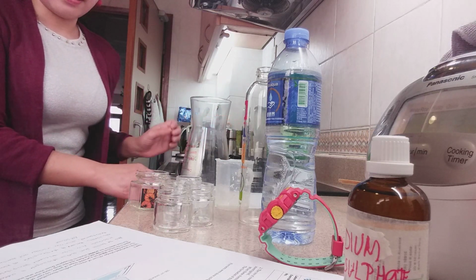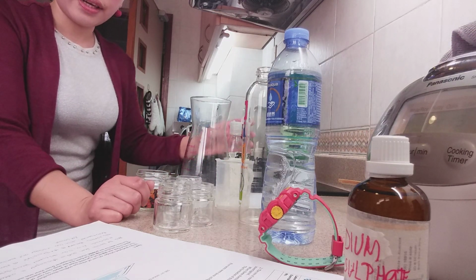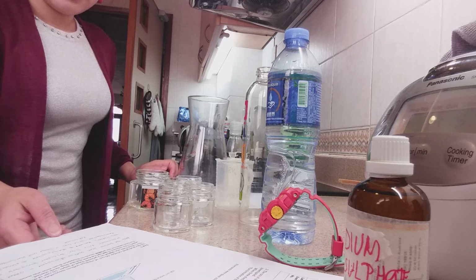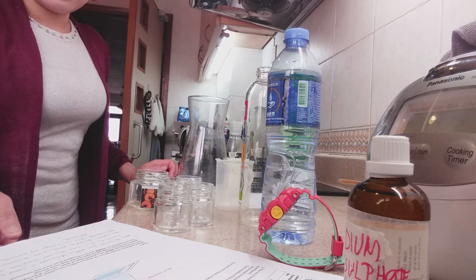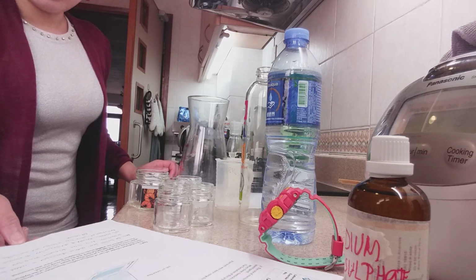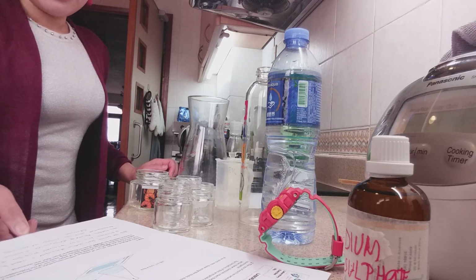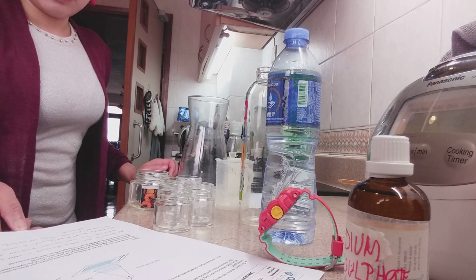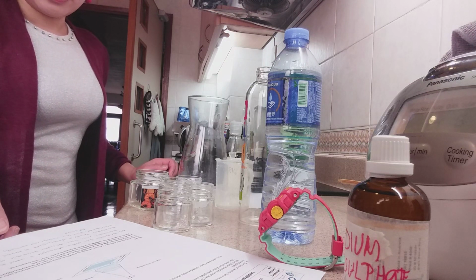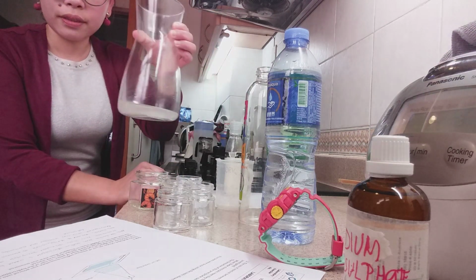The reaction between the aqueous sodium thiosulfate and hydrochloric acid is cloudy. So the answer: the reaction when sodium thiosulfate is added to a solution of hydrochloric acid is an insoluble precipitate of sulfur that is formed. This happens because of the precipitate of element sulfur that is being formed, which is insoluble and eventually clouds the water. It's cloudy.